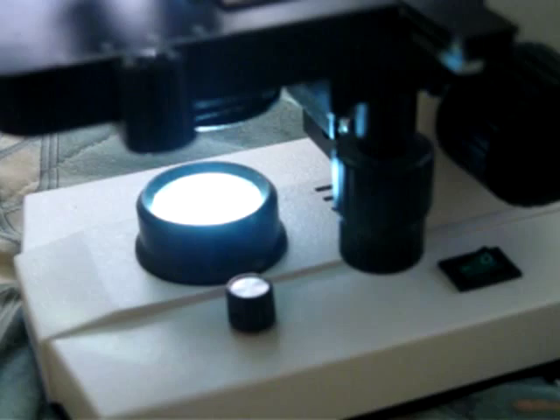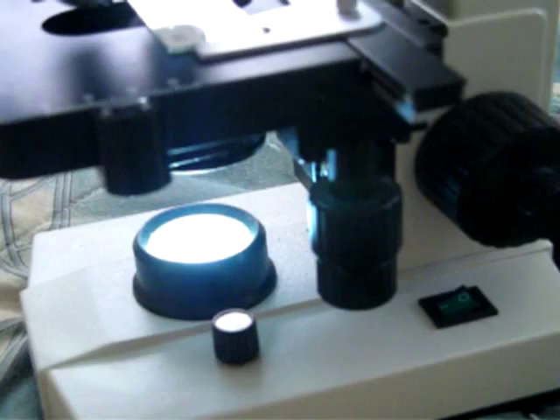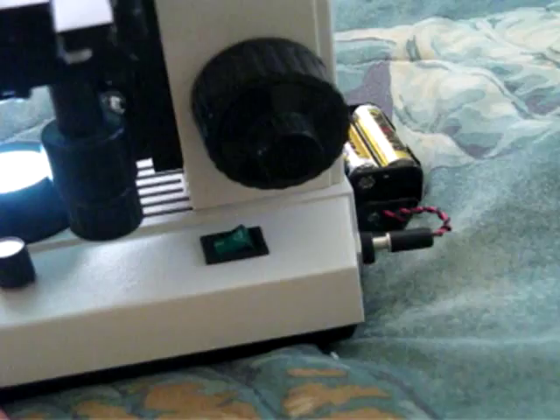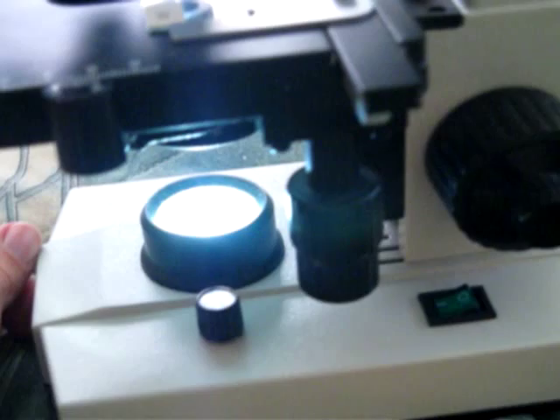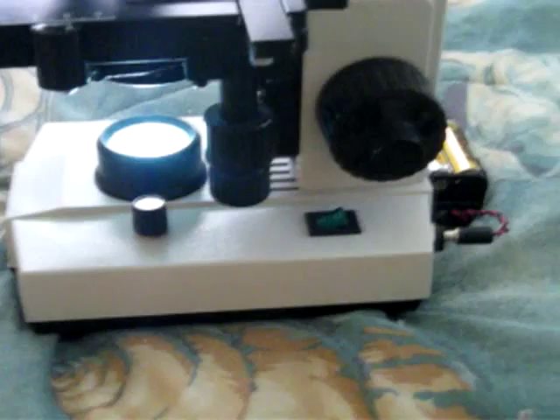The light color is pretty pure white, maybe a touch of blue. I had to remove the colored filter glass that compensates for the yellowish cast of the stock incandescent bulb that was in there. It produces almost no heat — there is some heat from the regulator system that allows adjustable power output, but it's probably like two percent of the heat output of the incandescent lamp. It's very cold light — white LED light. It was a small white LED flashlight that I tore apart and used the LED from, probably a watt or something like that, but it does very nicely.